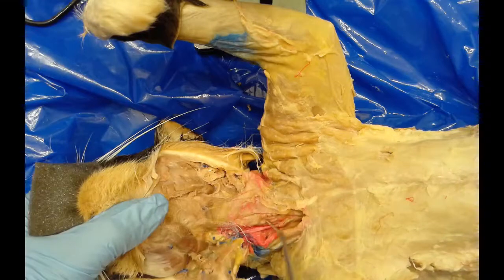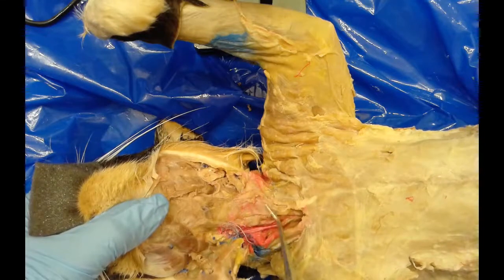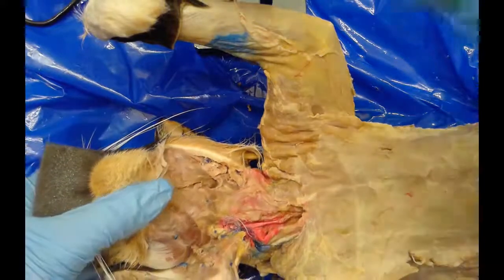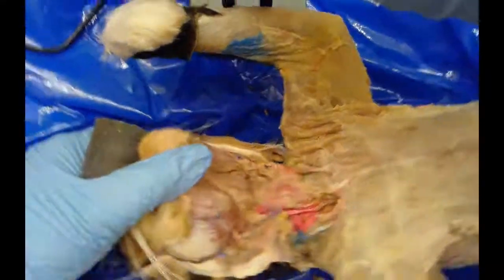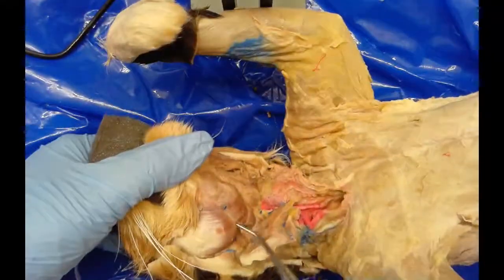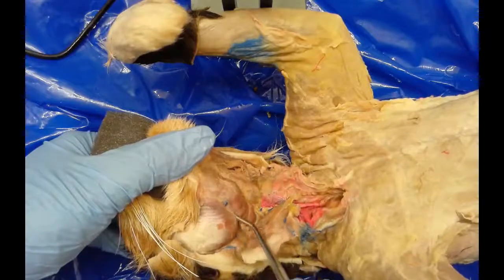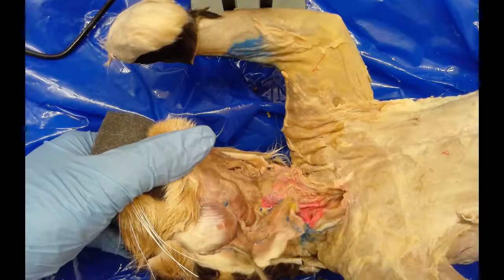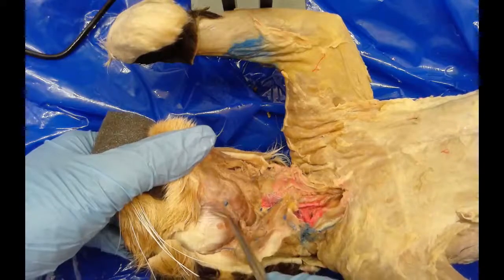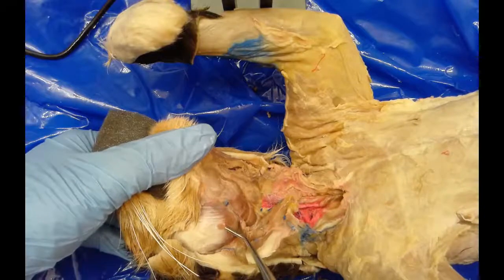These are muscles that run right on top of the trachea — you can kind of see part of the trachea right there. The masseter muscle is this huge jaw muscle right here — you can see this big bulge, which is the curved outer posterior border of that muscle. That's the masseter.